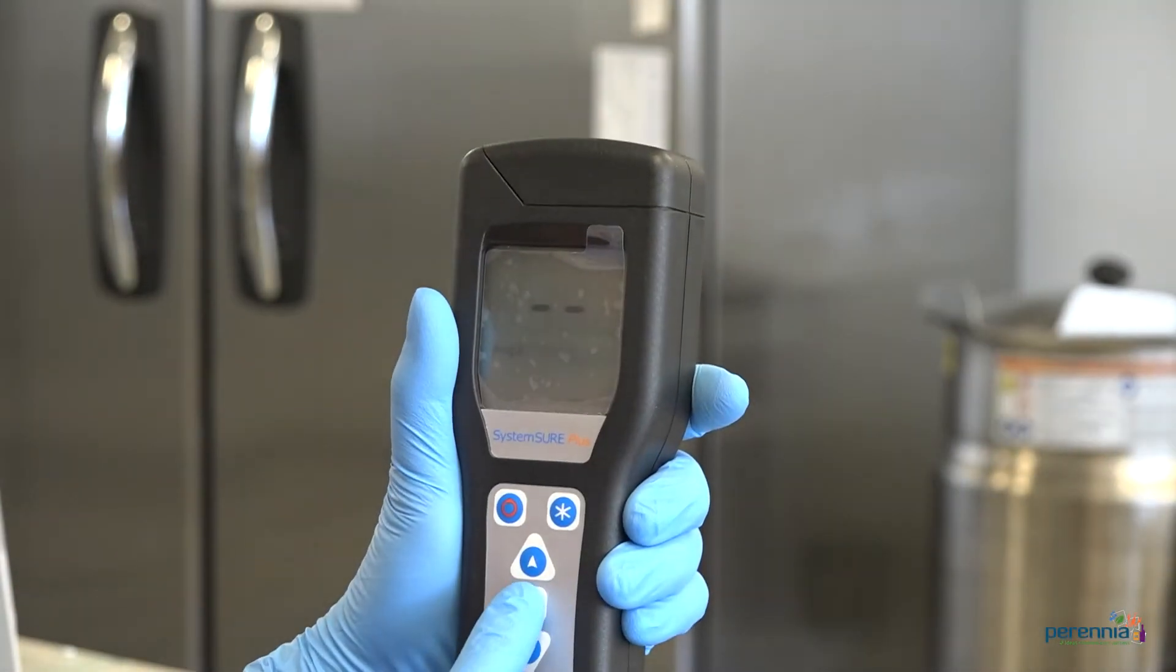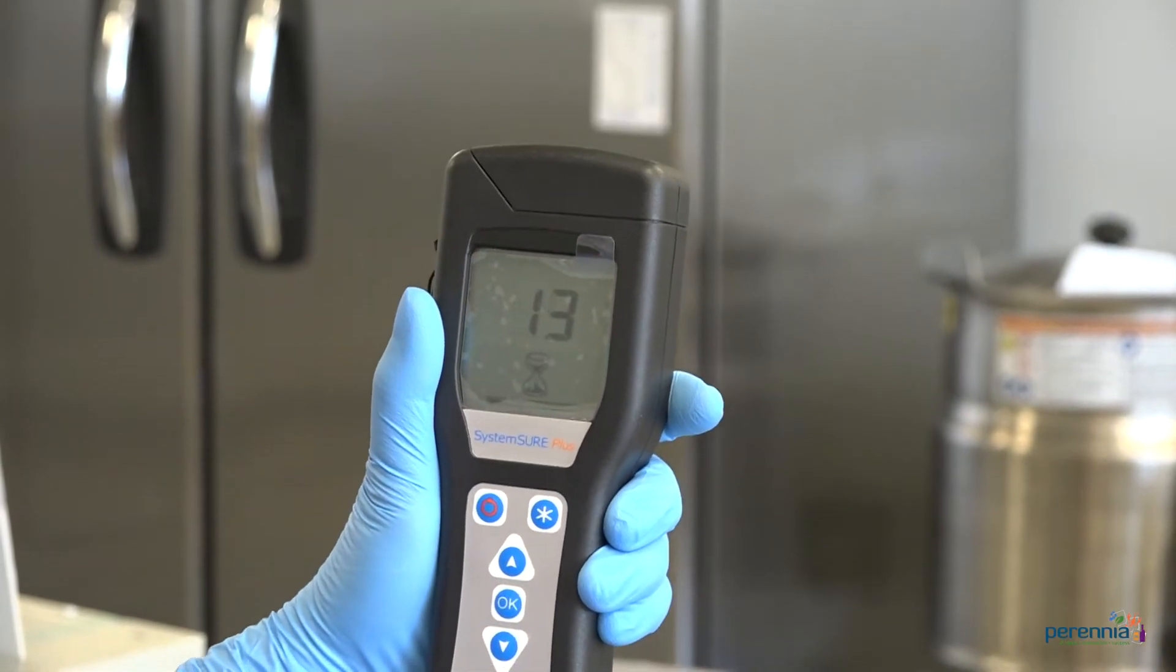Do this for the negative swab as well. Repeat two times for each.